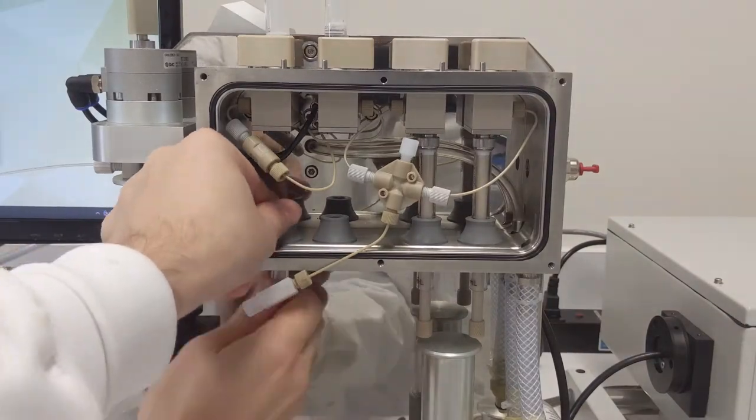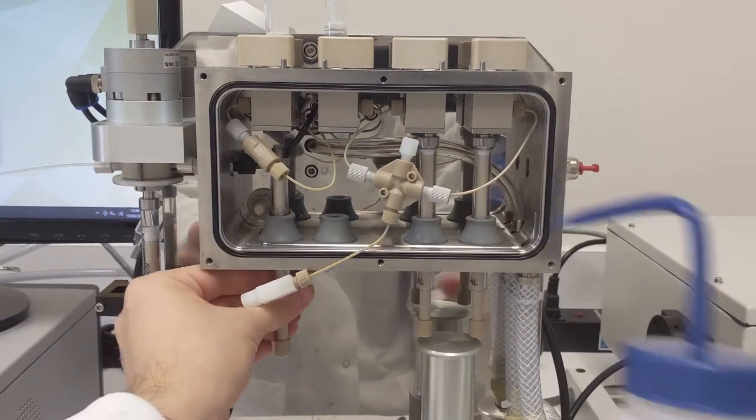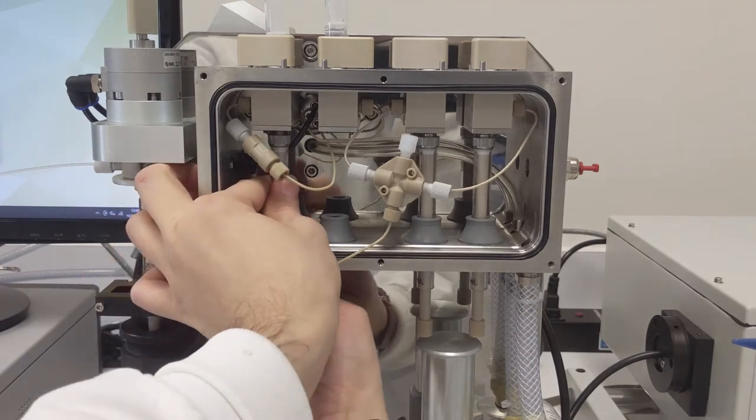To install syringes back, push them up through the grommets, but also lubricate them with a bit of water to allow for easy installation.